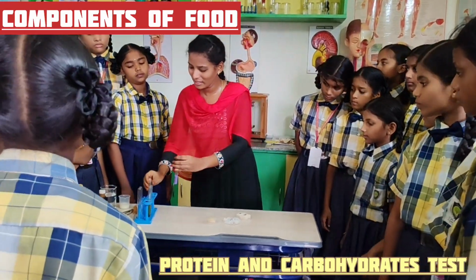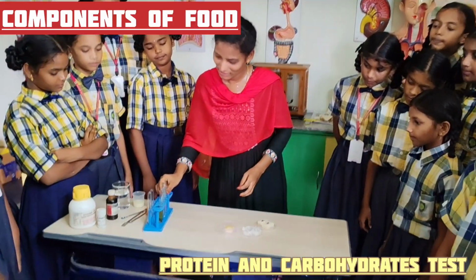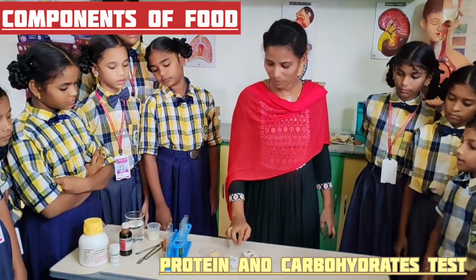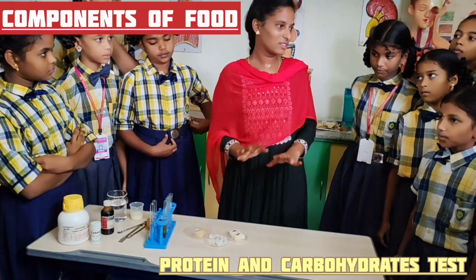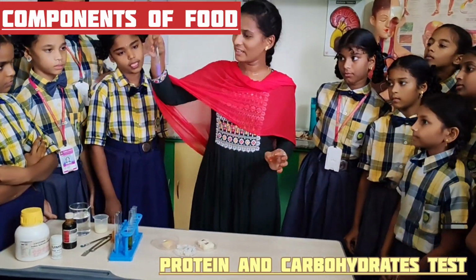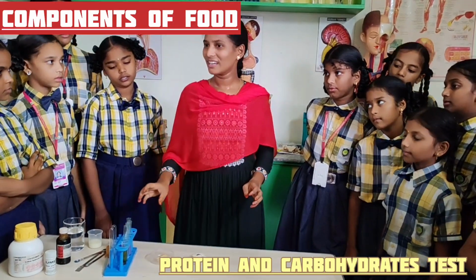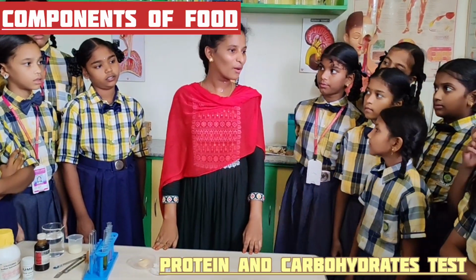Okay? Is it clear? Yes. All of you, is it clear? Yes, ma'am. So we came to know rice, bread and potato pieces are rich in carbohydrate. Milk is rich in protein. Very good. This is our second lesson activity, components of food.